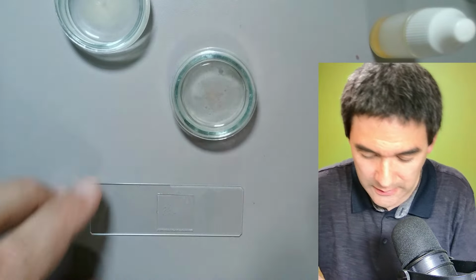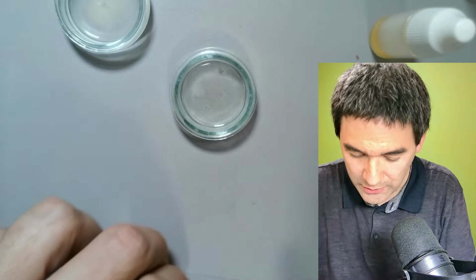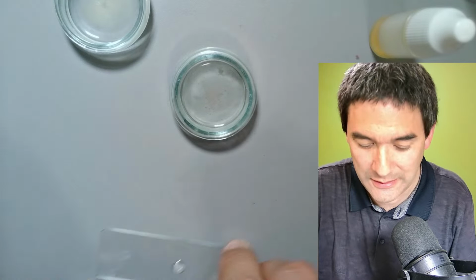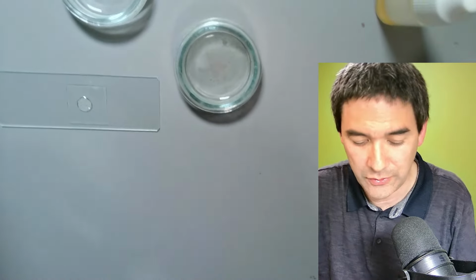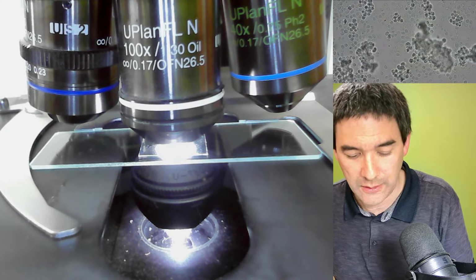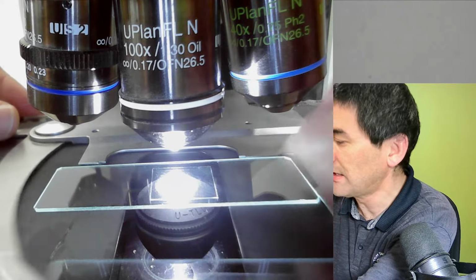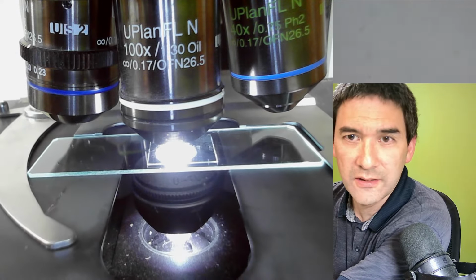Again here, you see there is sometimes a little bit of water on top. Here I added the oil. I have to readjust the camera a little bit. So I go back to the stage view, and I'm going to lower everything again using the coarse focus. I take the old slide out, I put the new slide in, and I use the coarse focus again to raise it.